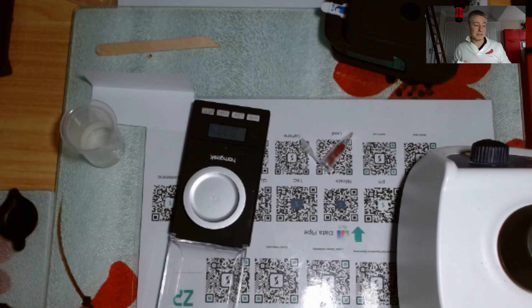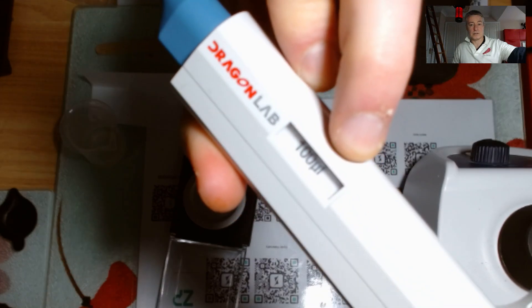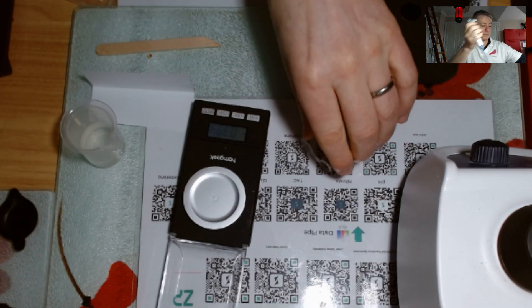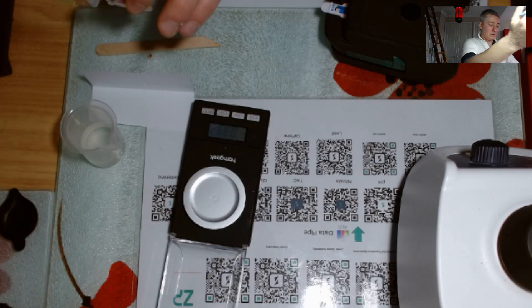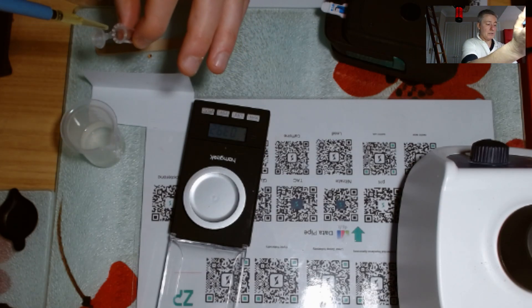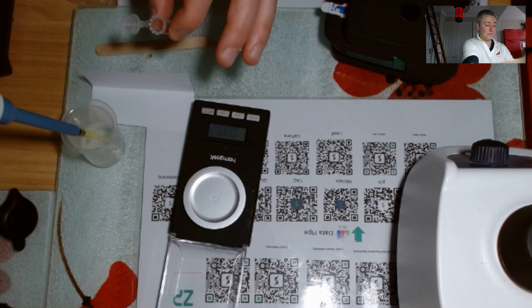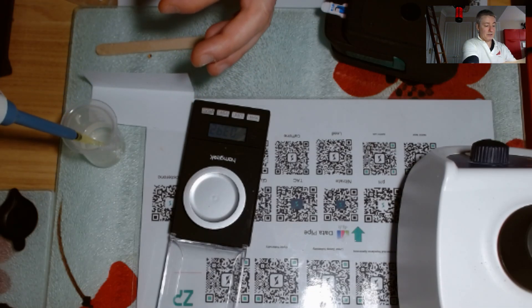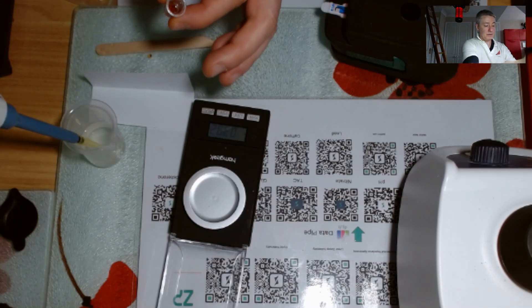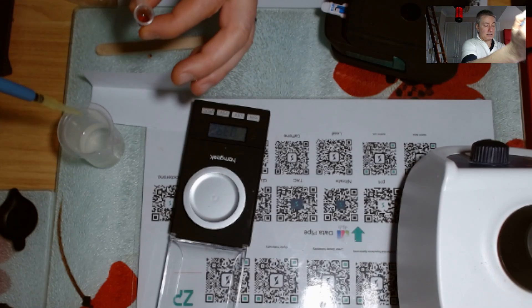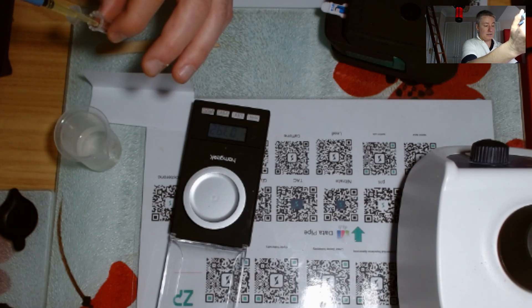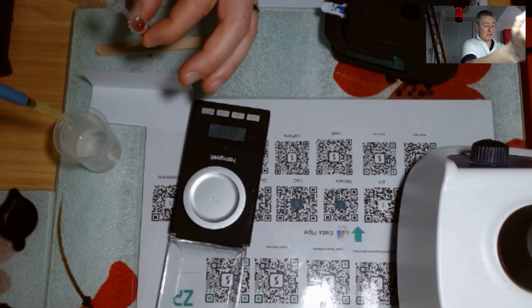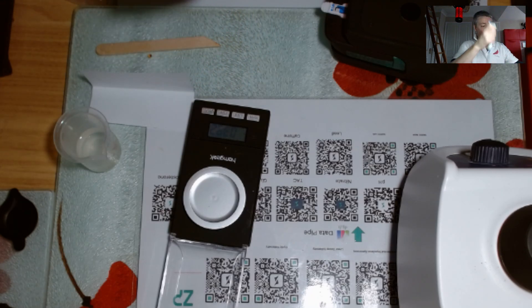Okay, cool. Alright, so I've got my chilli material in there. I'm just going to put it down gently for a second because I want to put 900 microliters into there as well, so I'm just going to add nine of these just real quick. 1, 2, 3, 4, 5, 6, 7, 8, 9. Right, so I've done that.